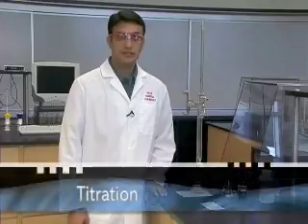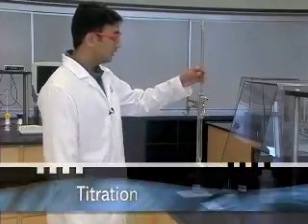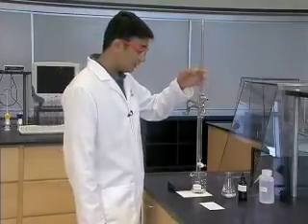Now that you have cleaned, conditioned, and filled the burette, it is time for titration. The burette is firmly clamped into the burette clamp at the bench.